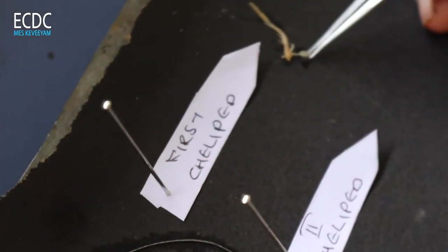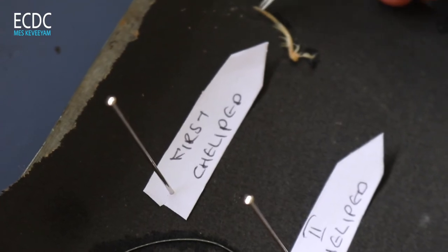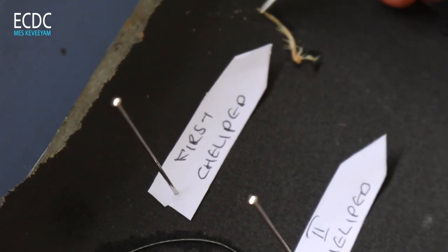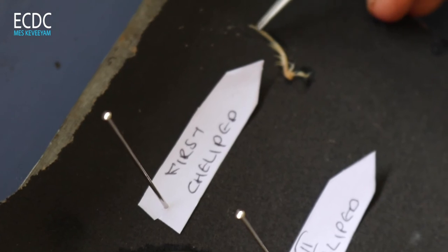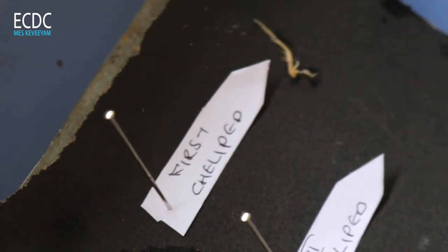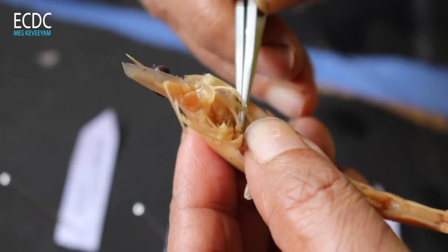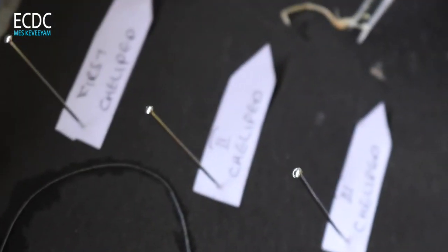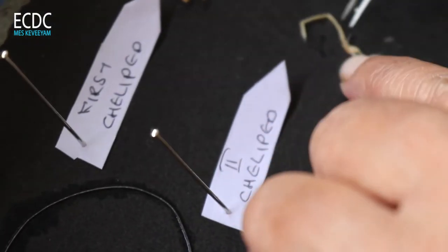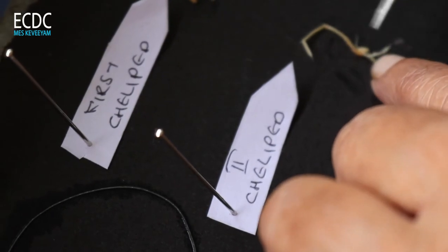This is the first chelate leg with epipodite. This tip will be used to identify the chelate. Next leg. Here is the epipodite.